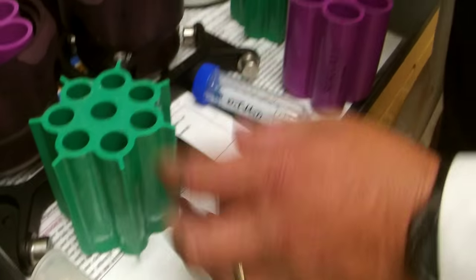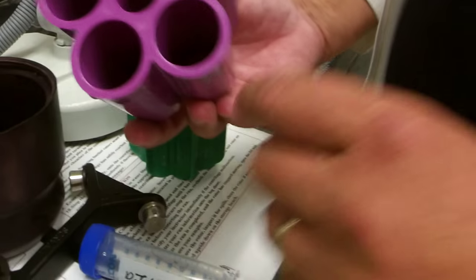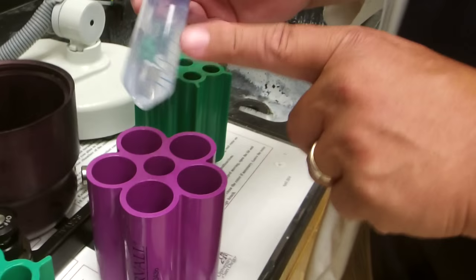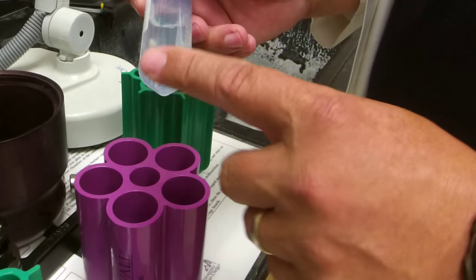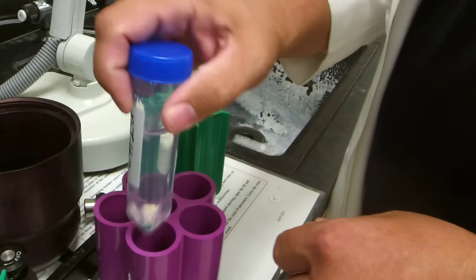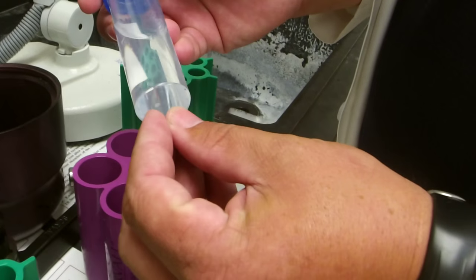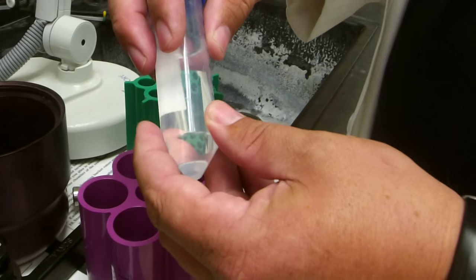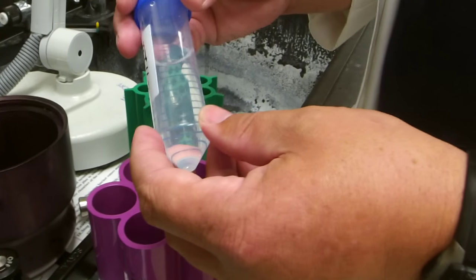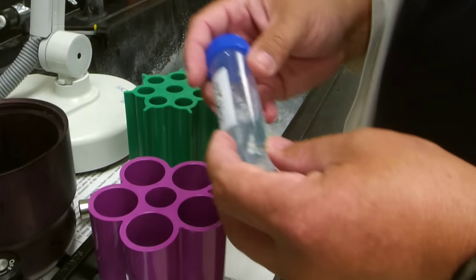If you look at the bottom of this adapter, you can see that they're conical. These are meant to fit conical-style tubes. If you don't support these conical tubes in this type of head, with enough G-force you'll start warping out the plastic. You'll lose your sample, the sample will spread throughout, you can get contamination, and you could certainly unbalance the centrifuge — potentially ruining a very expensive piece of equipment.